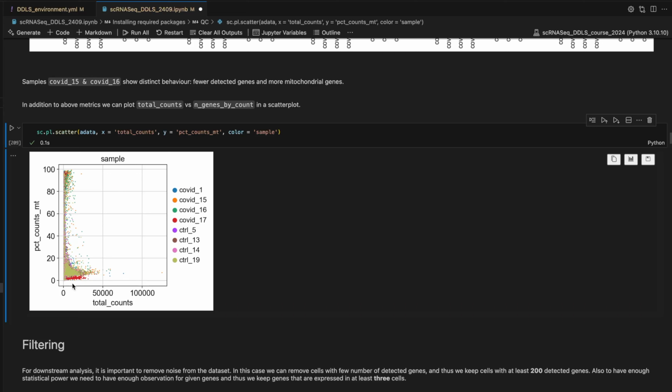The first thing that you can see is that the samples that have high total count tend to show lower mitochondrial percentage. And for some samples, since we are plotting all of them on top of each other, we cannot pinpoint exactly which sample, but we can see control 19 and also COVID-17 tend to show the same pattern. But for the rest, we can see it here and there, for example, 15 and 16 tend to have higher mitochondrial genes.